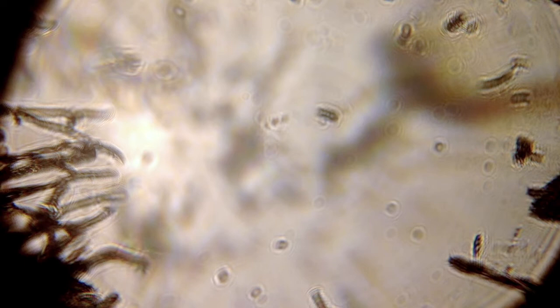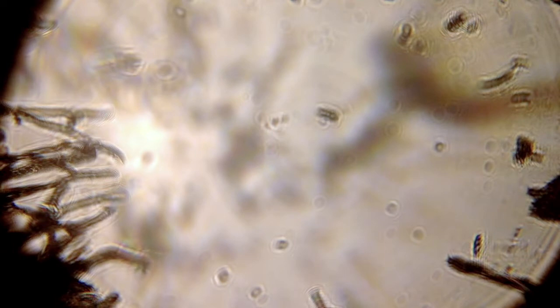Here's an old school diatom fixed slide for teaching, like where they've lined them up and there's text that you can read. Oh, sorry, it's upside down. But you can see the different diatom frustules there. And then here's the last one I'll show you. This is a fixed slide that we made. That's the gut of a termite, Paraneotermes simplicicornis.